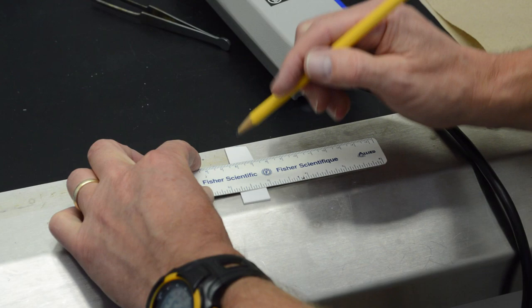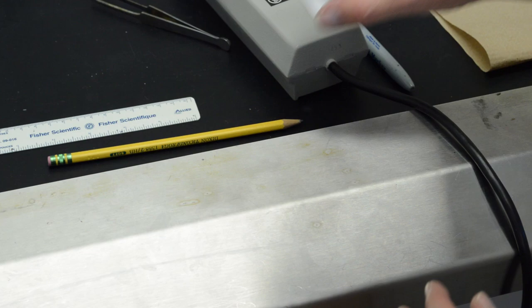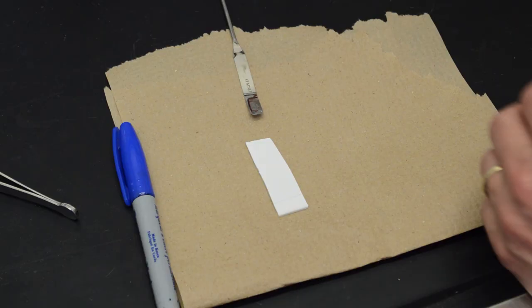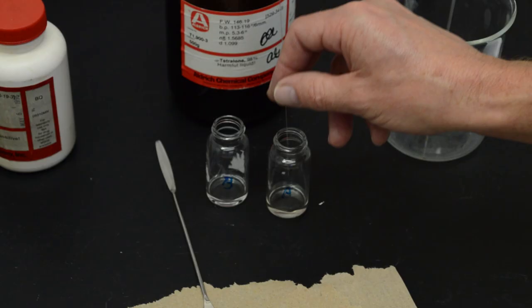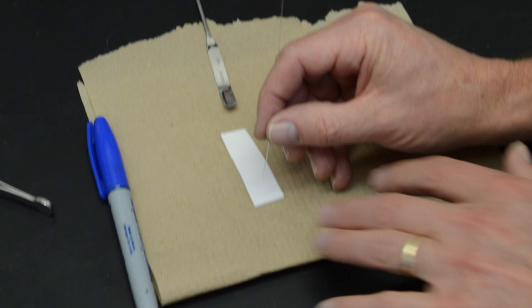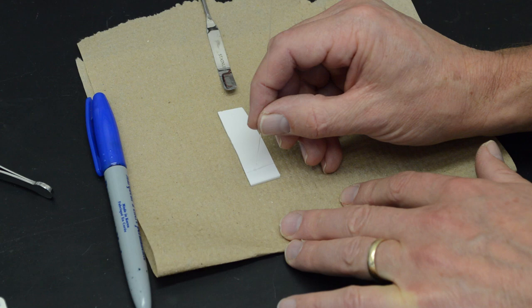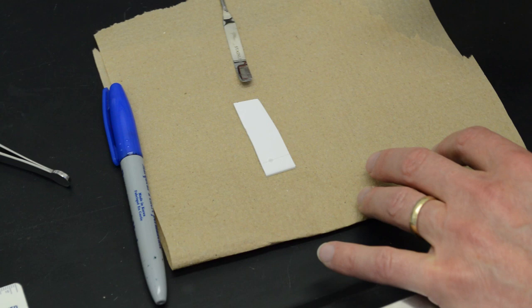So, then we put our plate down in the fume hood. We take a spotter and make sure that the end is broken off flat. And we will stick this into solution A. And we will give it a little dab right on the pencil line on the left. We tap it once and then we will tap it a second time. And you can see that the solvent is evaporating.